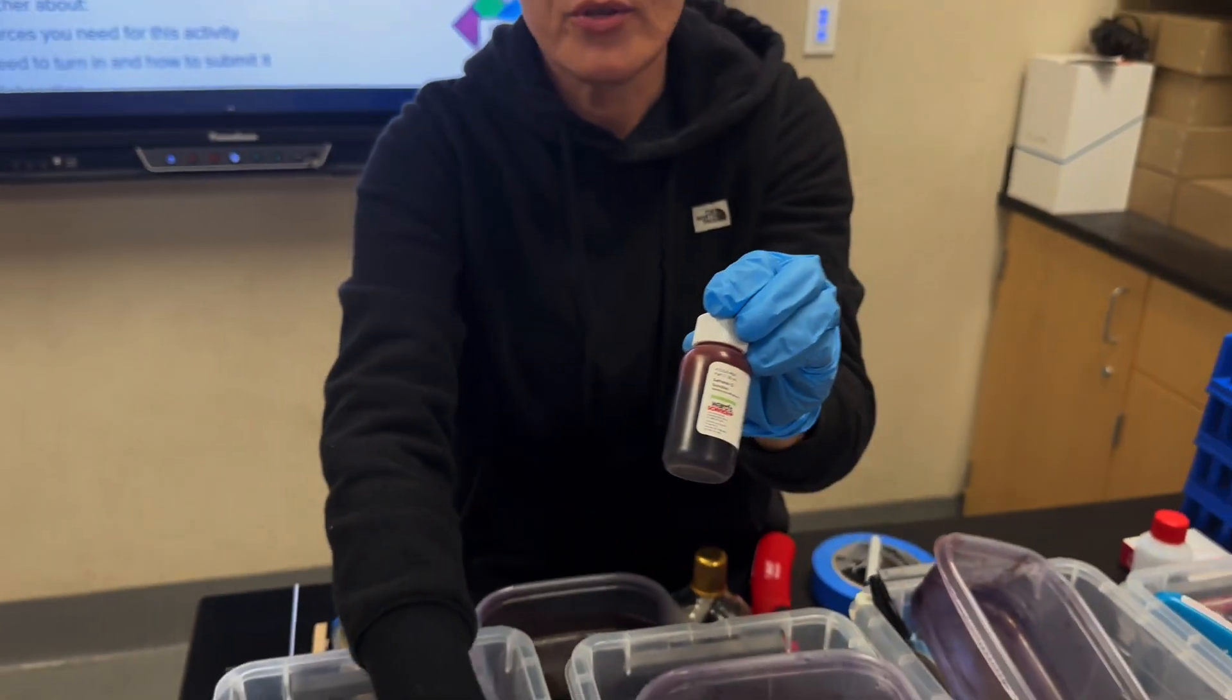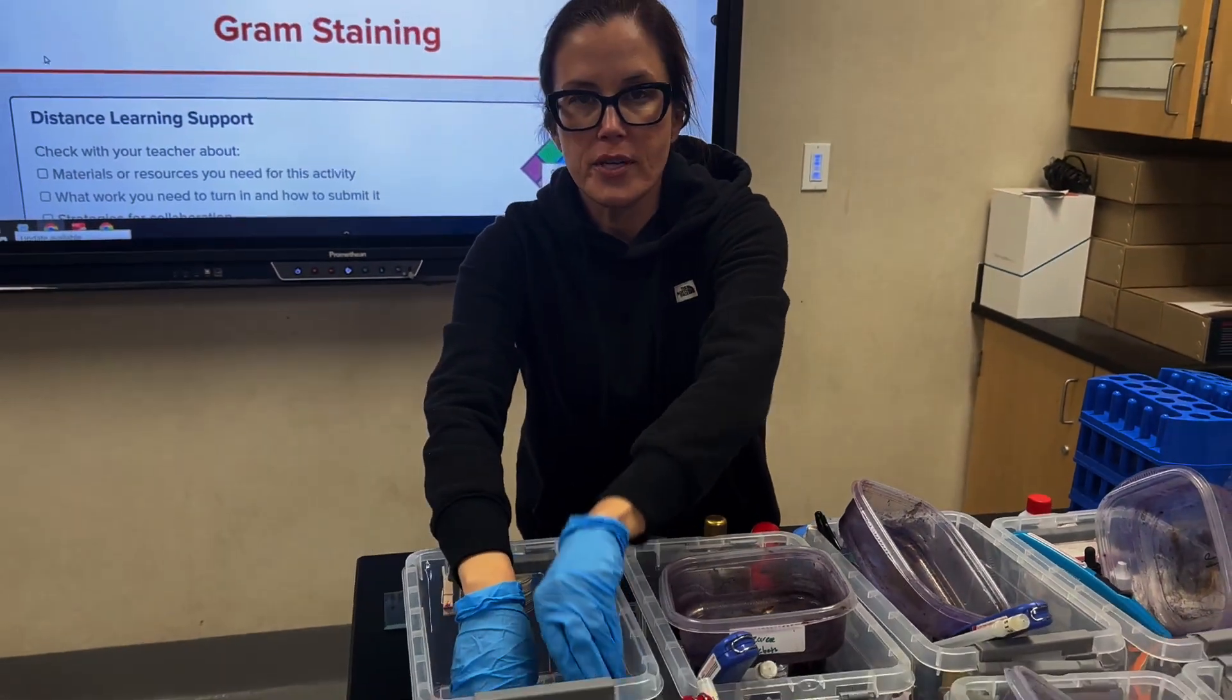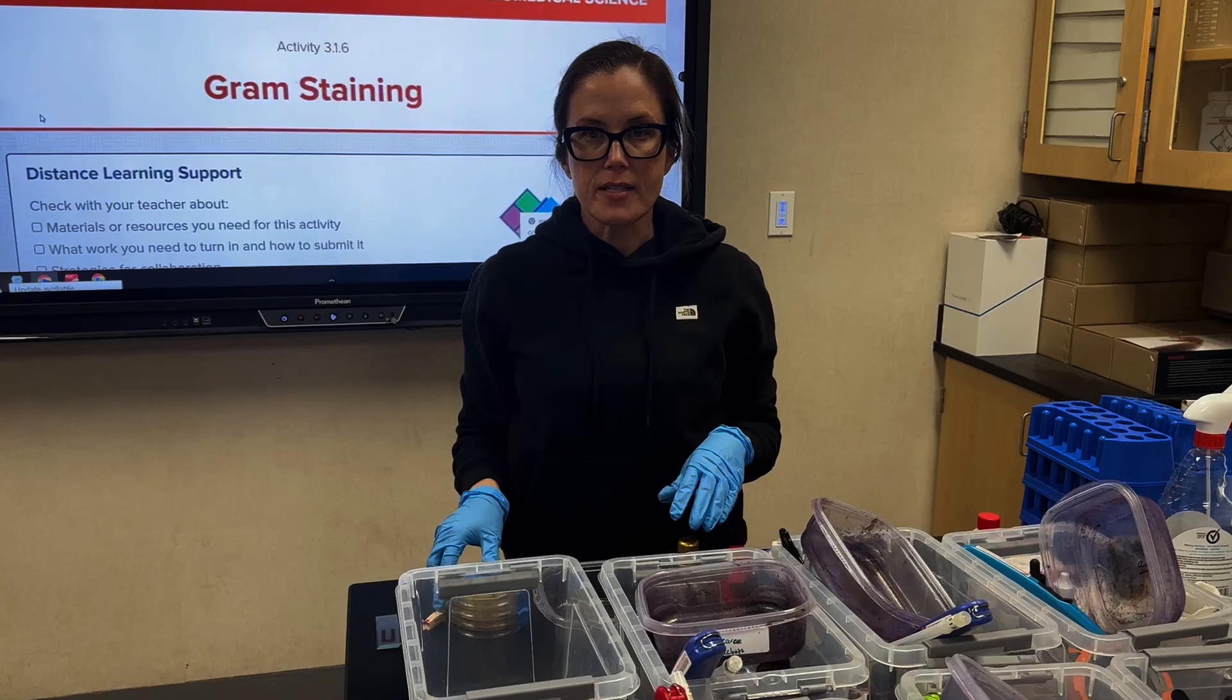And those are all the supplies that your students will need to conduct 3.1.6 as part of the experiment.